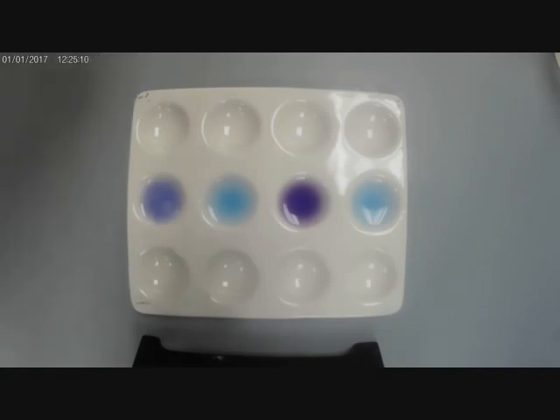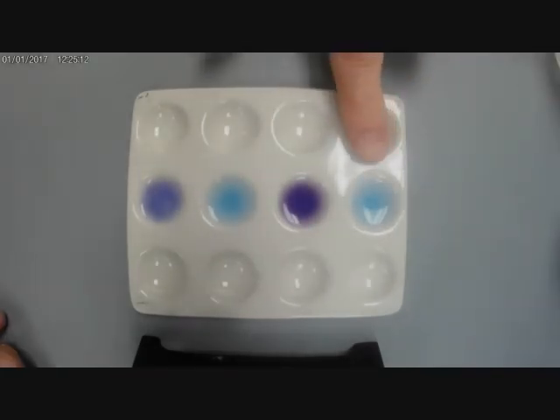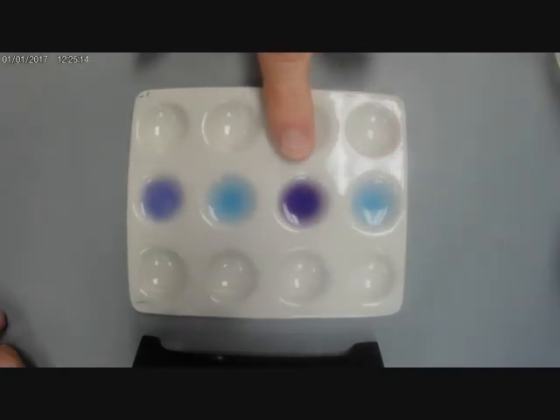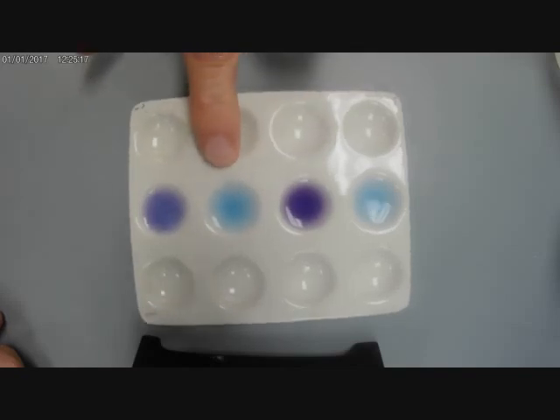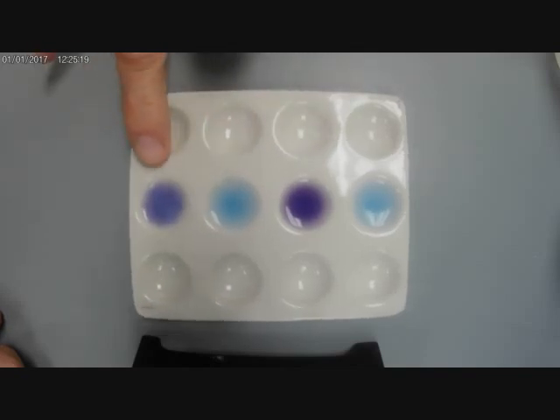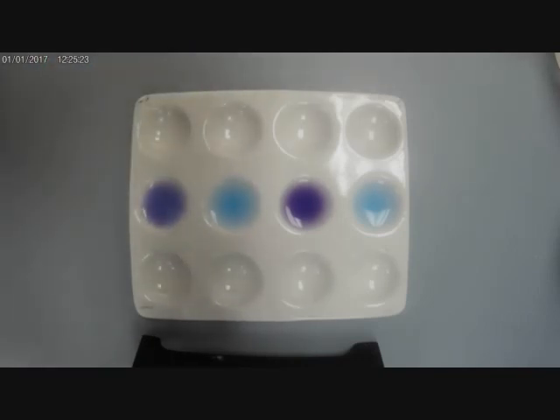So once again, here are our results. This one is water. This one is albumin or egg white. This one is starch solution. And this one here is milk.